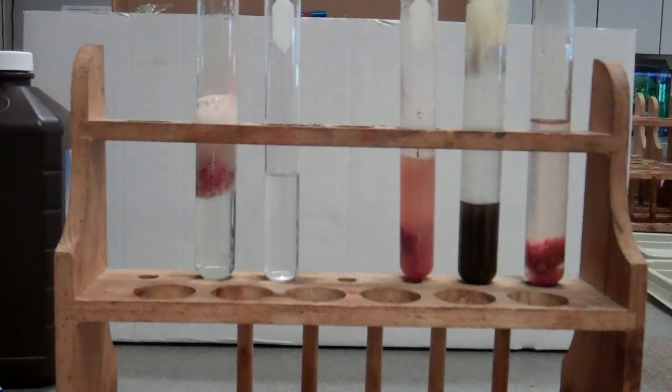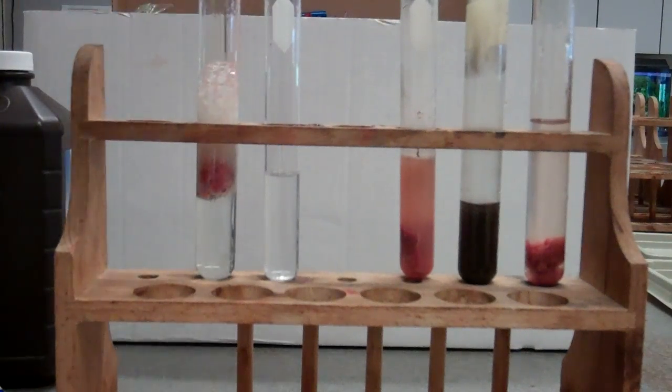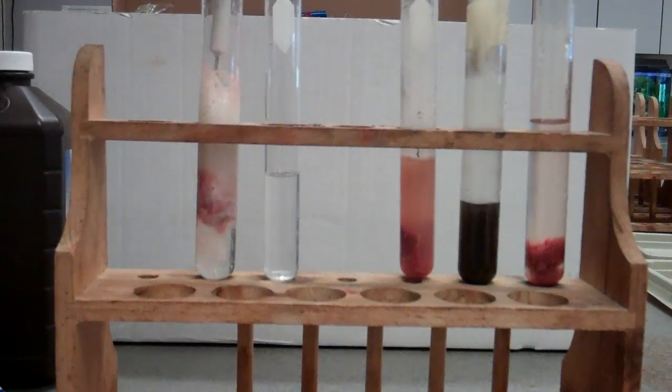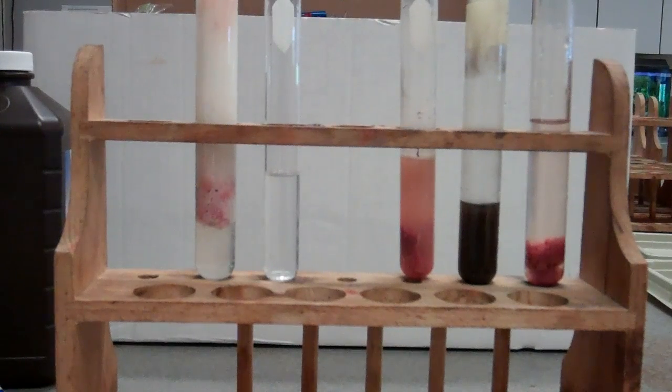Okay, yes, we see it's happening. We know it. We've done it before. This is all moving forward well and good. I can push it around in there a little bit. I can get it really going here. I can let that go for a little bit.